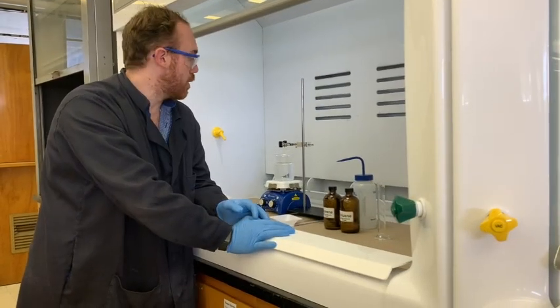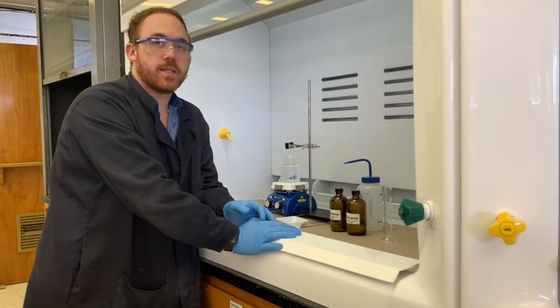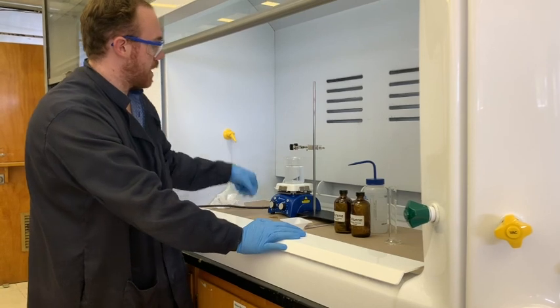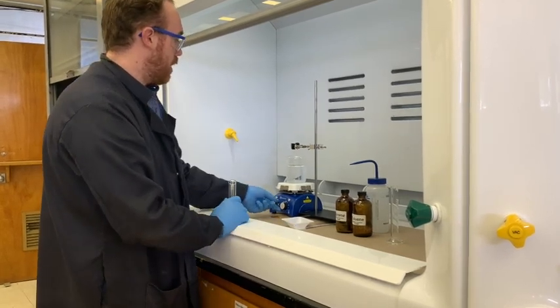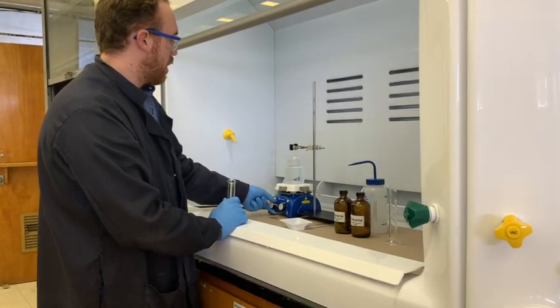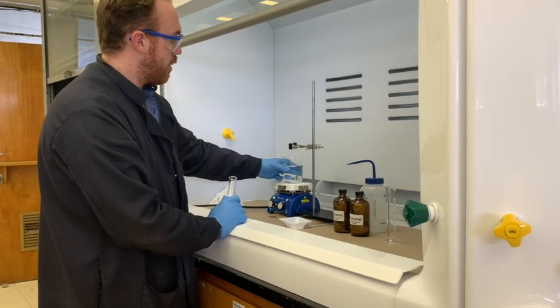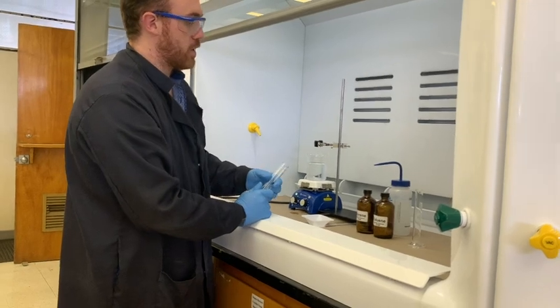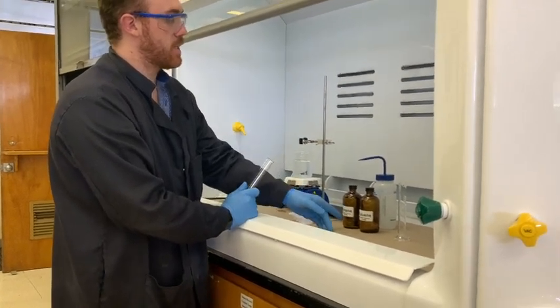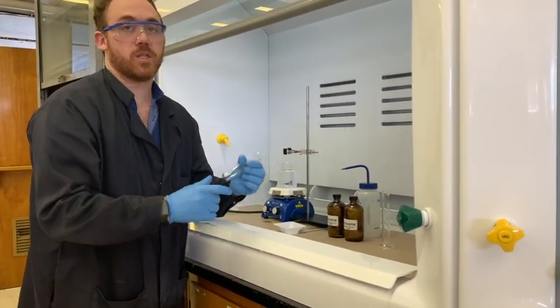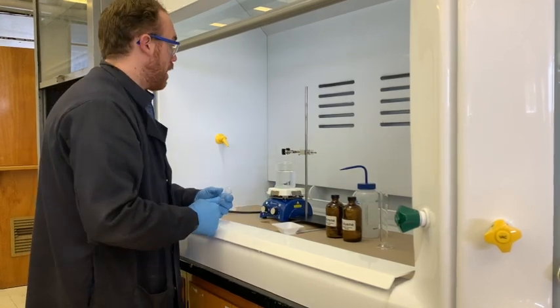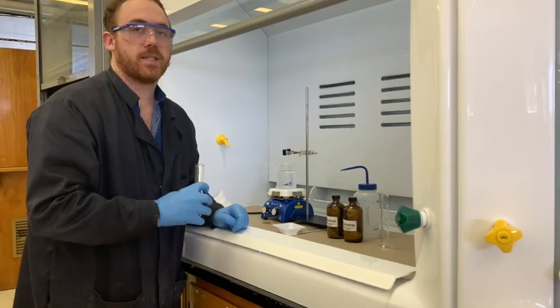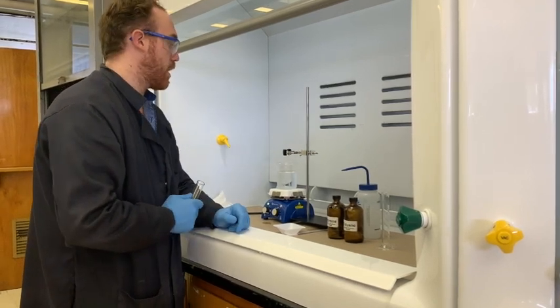When it comes to looking at the process here, it's going to be very simple. We're going to just take this test tube. It's going to be heated in a water bath on this hot plate and we're going to just place some of the toluene and styrene into this test tube, which has been very carefully dried. And then we're going to place the radical initiator inside the test tube to allow the reaction to begin.